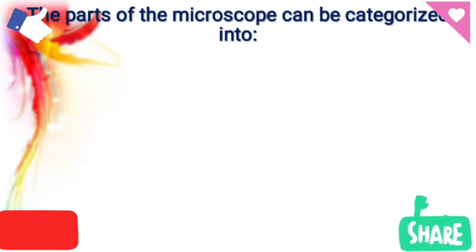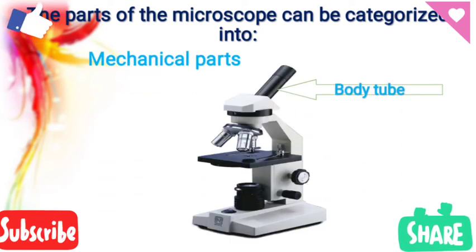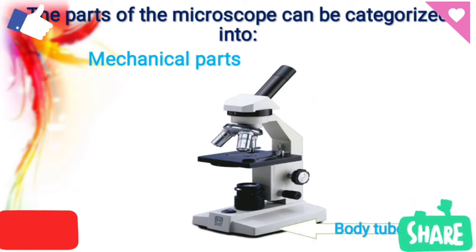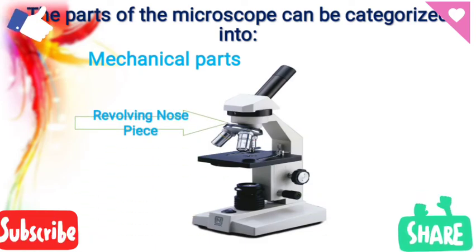Till now we have studied a lot of microscope parts but it may be confusing. Let's begin once again and see which part has which particular name on the microscope. Let's begin with the mechanical parts. This is the microscope body tube. This is the body tube. Then we have the arm. This is the arm. Then we have the revolving nose piece. Only this revolving thing, the nose piece.